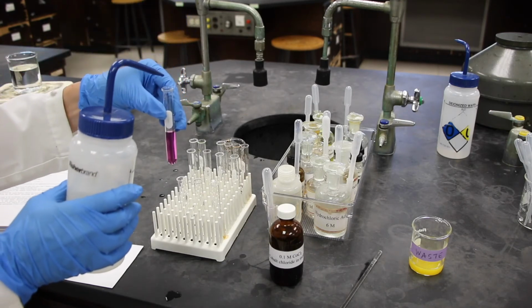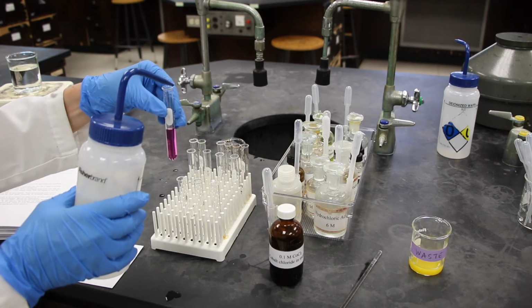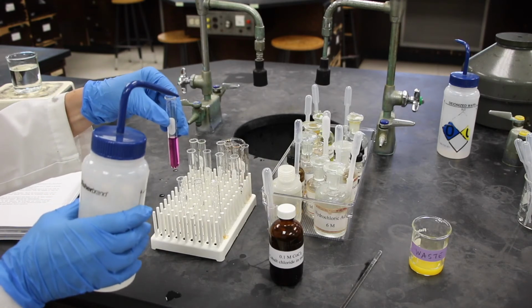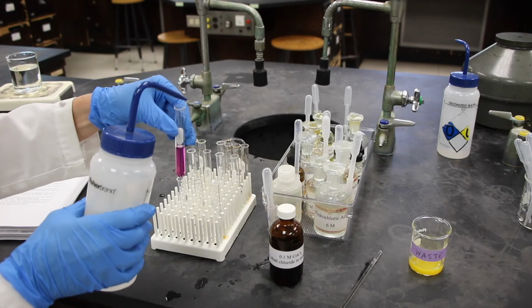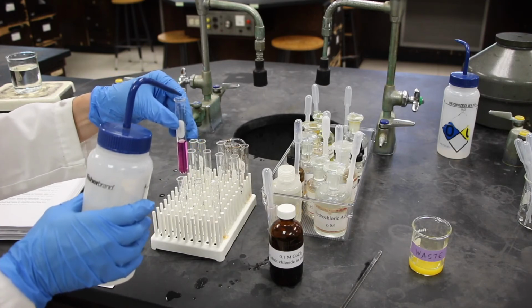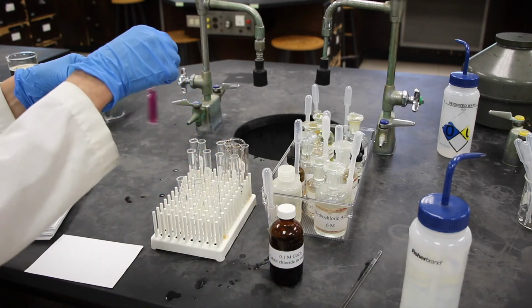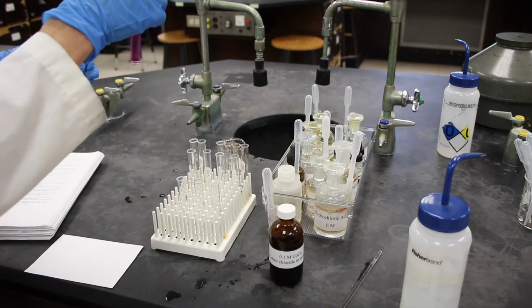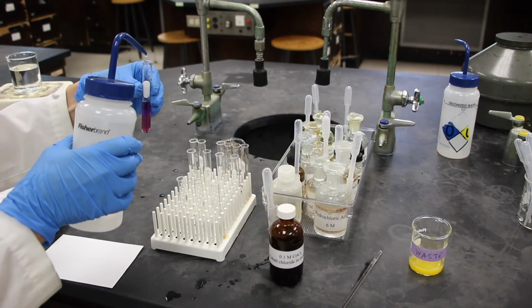Maybe one more drop. Doesn't take much to change it. Okay, one more drop.